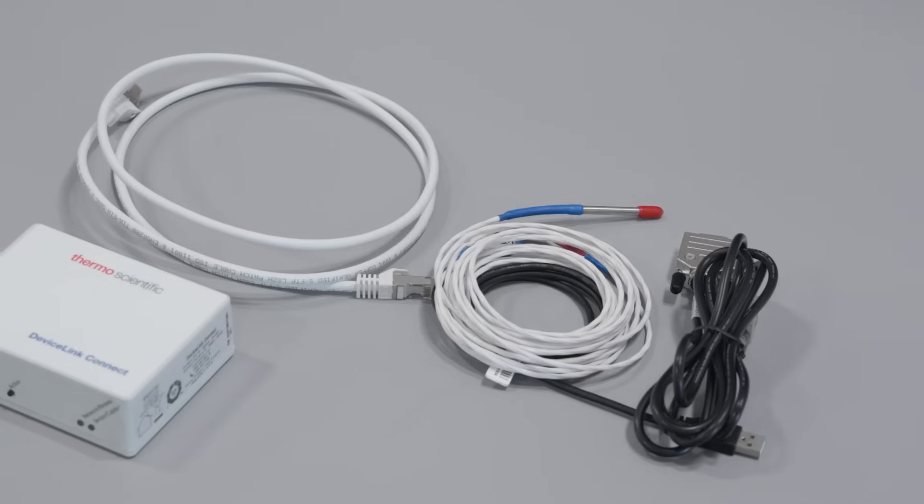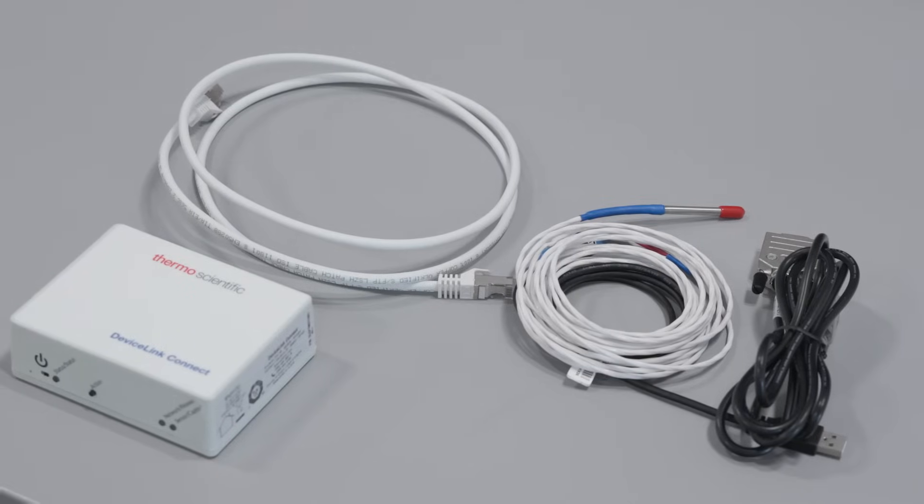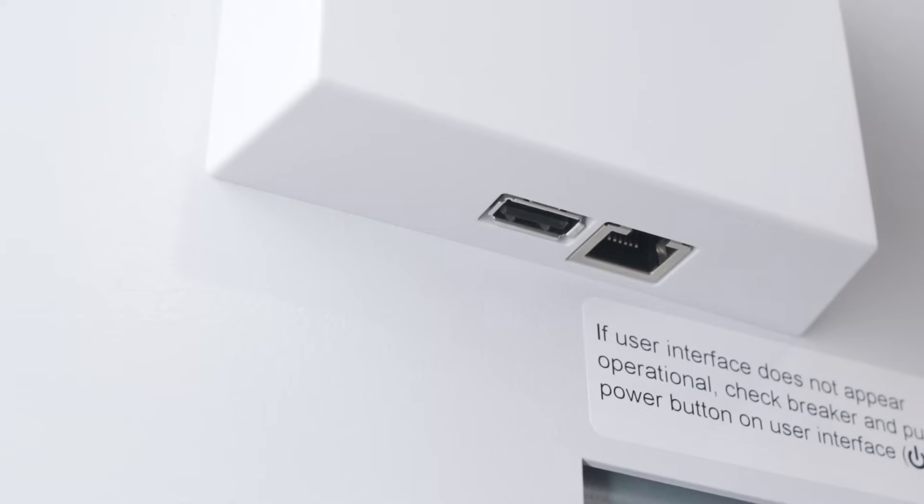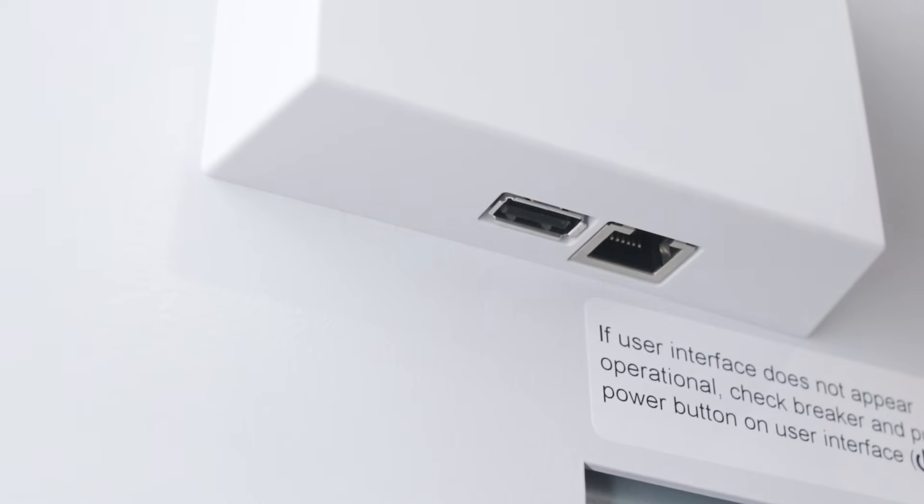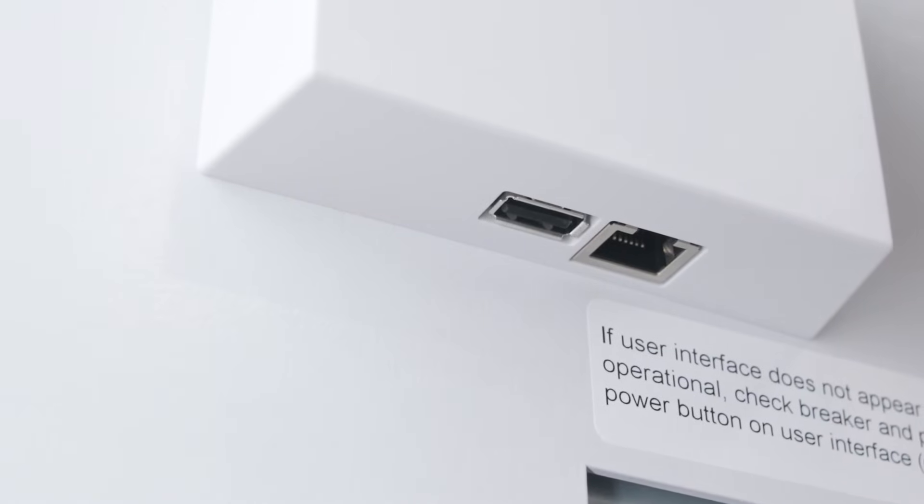Many monitoring systems only require a small amount of DC power. These types of solutions can plug directly into the 5-volt port.